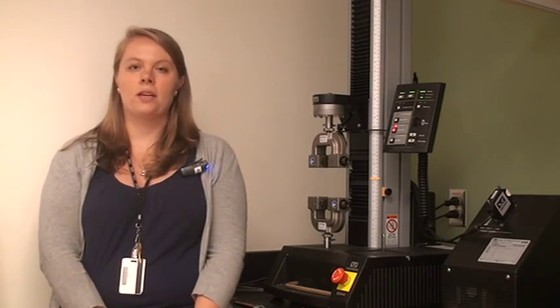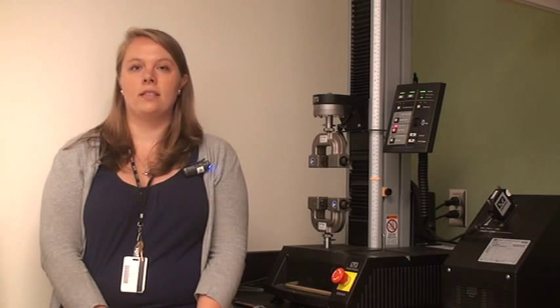Hello, my name is Jen and I'm from the biomedical engineering department at Worcester Polytechnic Institute. I'm here today to show you a short video tutorial on how to install and remove the screw action grips for tensile testing on our Instron 5544 materials testing system.